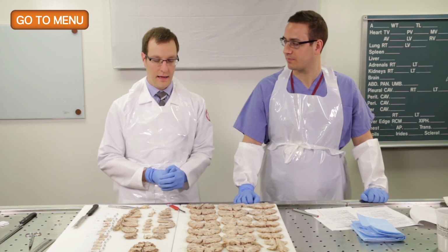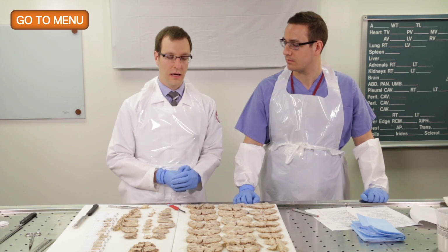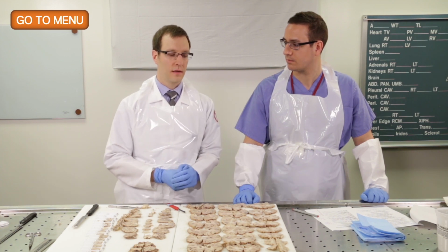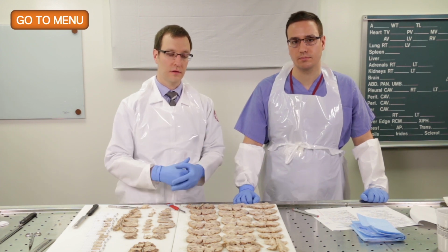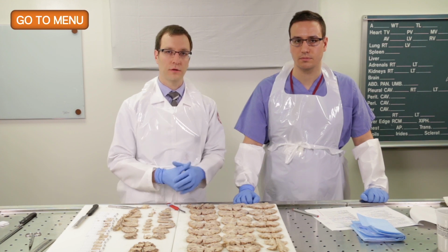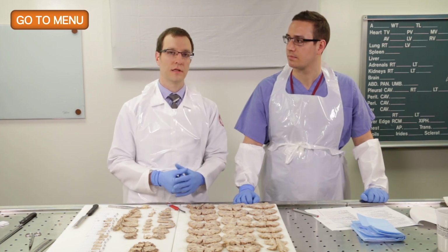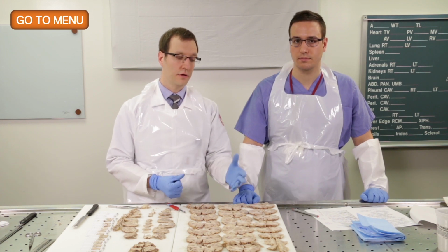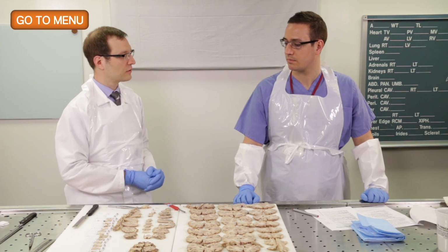Thank you. And again, whenever you have any questions during the autopsy itself, with the fresh brain in your hand, you should always feel that both Dr. Levy and myself are available to come take a look at the brain in the fresh state should you see any lesions that you want to, for example, notate in the PAD. So with that, do you have any additional questions?